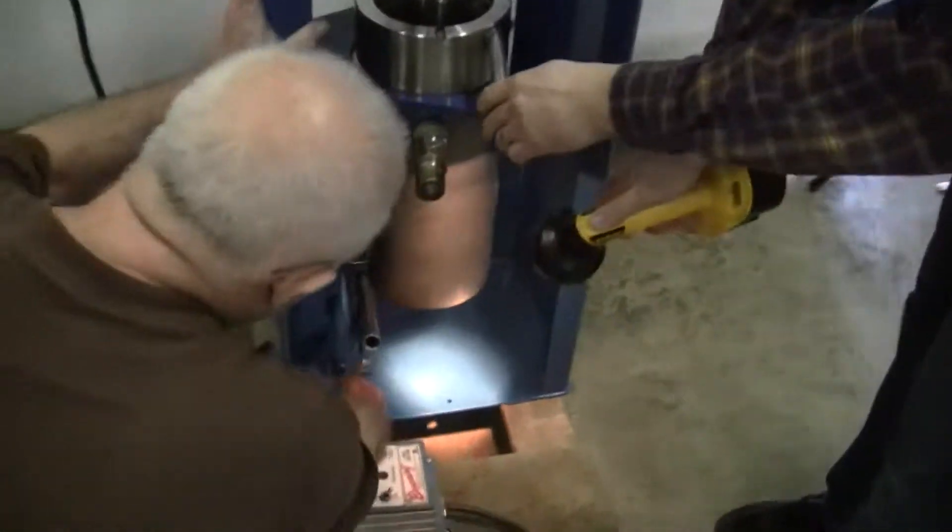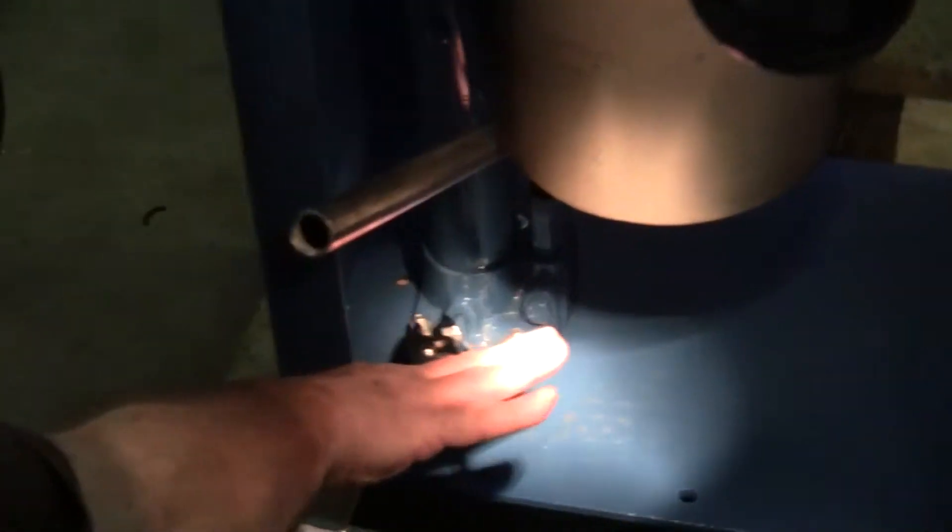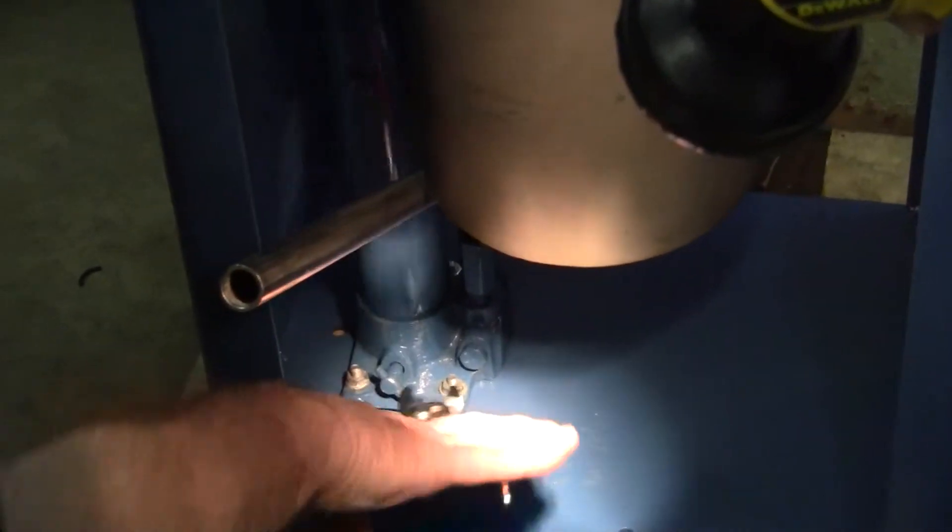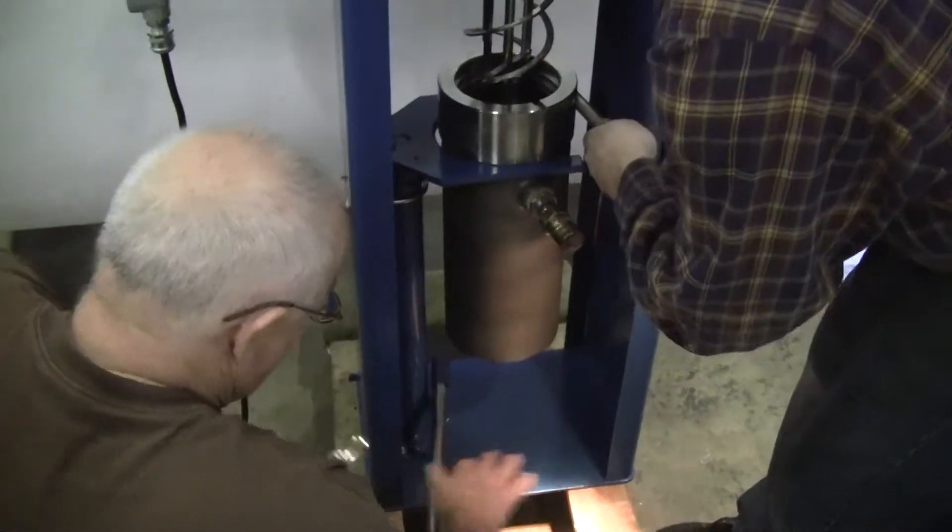Sam's going to tighten up the hydraulics down below. Then you would crank it. Not hitting that. Crank it up.